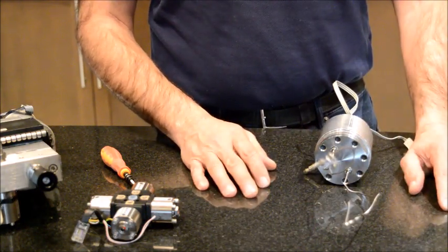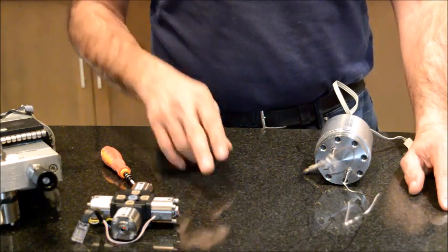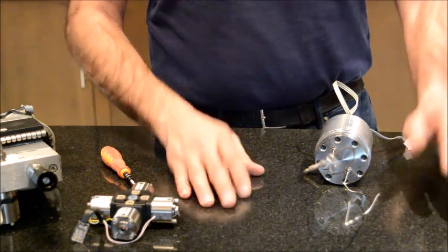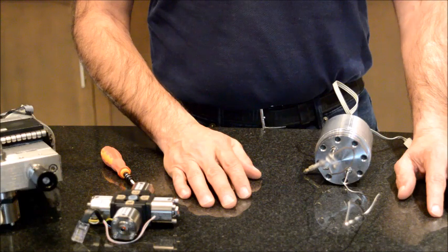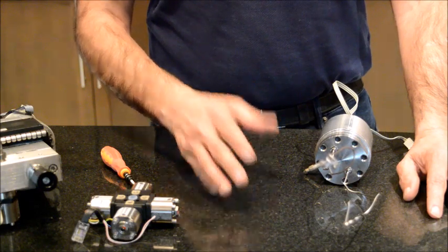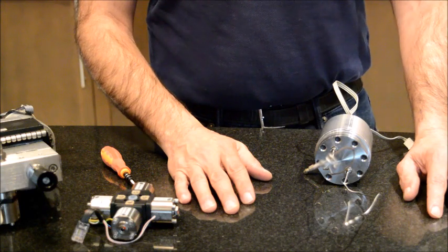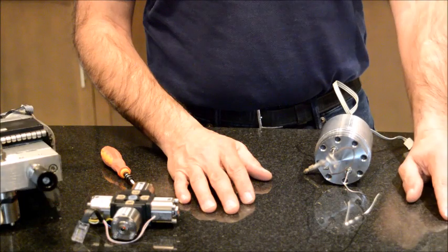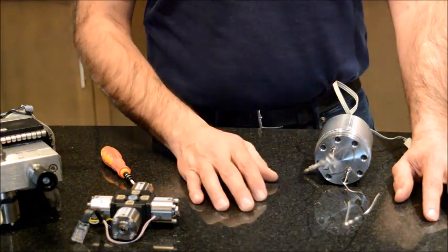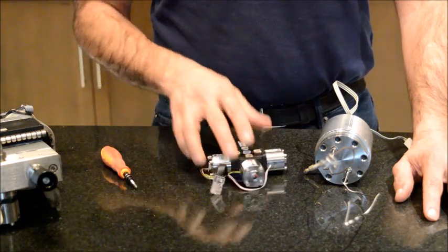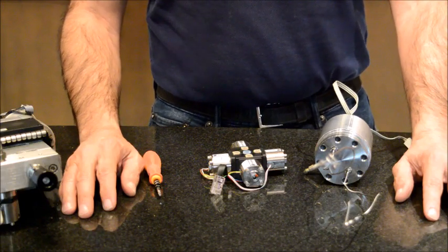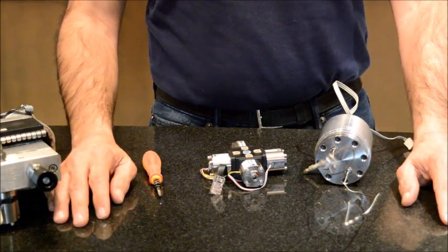If the damper doesn't work properly, what you will see in your baseline is that it is zigzagging, just jumping up and down. There is a pulse, and as you increase the flow of your pump, you realize that this pulsation also increases. That's the indication that maybe your flow damper is not working properly. But I would encourage people not to blame the damper first. There may be other reasons for your baseline fluctuations, such as leaking in the system or maybe your lamp doesn't work. Through my experience, I might have recalled only once that the damper had to be replaced. My recommendation to you is do not blame the damper and leave this replacement of the damper as your last choice. This is all I wanted to show you at this moment. I'm going to go back to my computer and probably show you a few more slides to summarize all the problems with the pump.